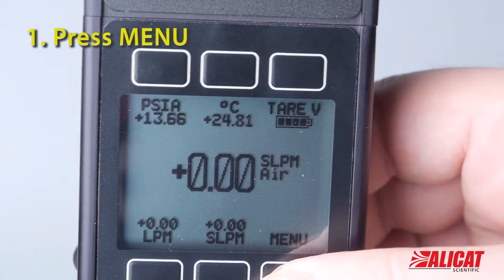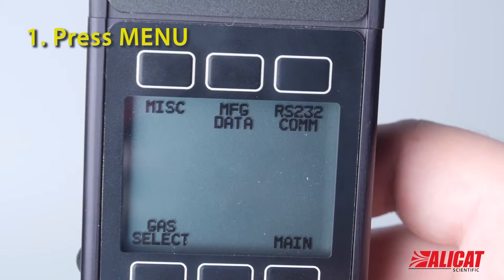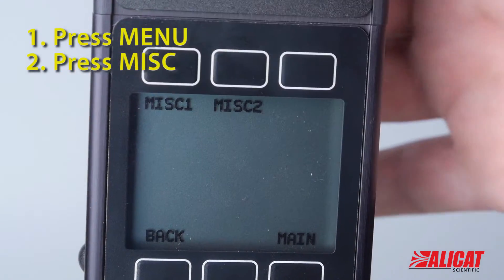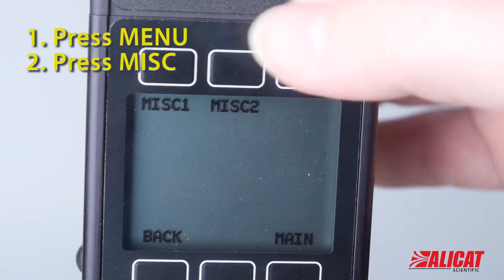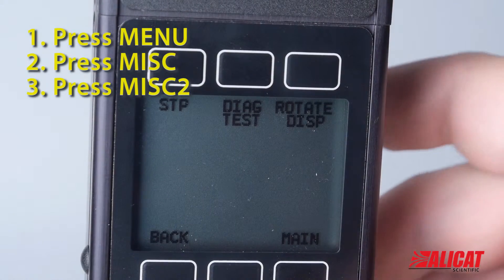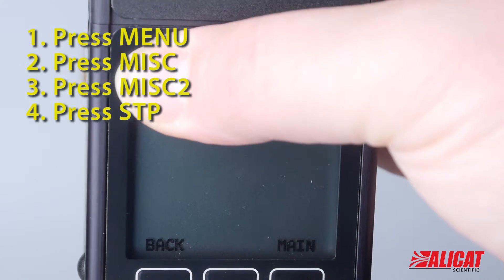Press the bottom right-hand menu button, then the miscellaneous button, and then the miscellaneous 2 button from the miscellaneous screen. In the top left-hand corner you can see the STP choice.